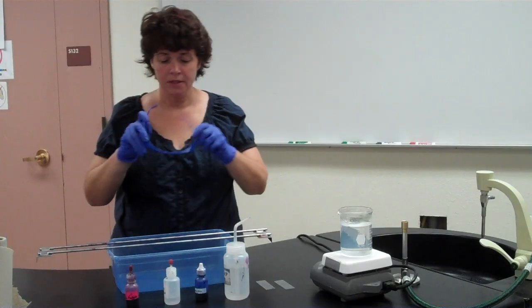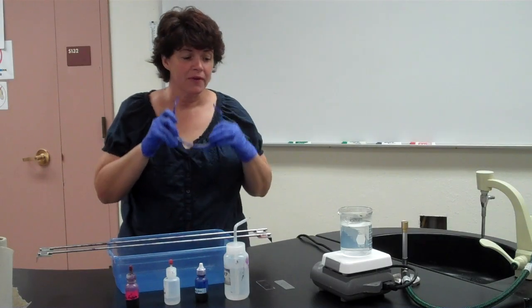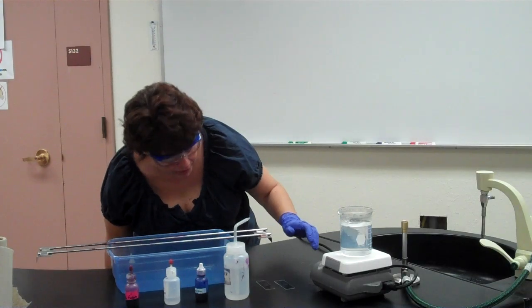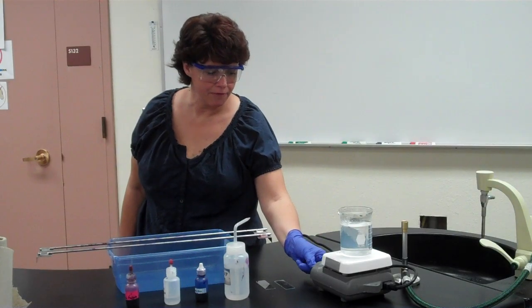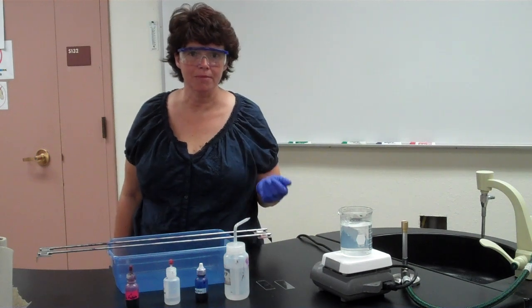So for this, one of the things you want to think about is I already have this on. It's been on for a while. We all know how long water takes to boil. So you don't want to wait till the last minute to start boiling your water. Okay, you want to have it boiling. Now, you don't actually see it boiling, but you can see steam is coming off of it. So we want it just enough. It doesn't have to be any kind of rapid boil. If you get it boiling too much, you want to turn it down. The idea is you just want steam coming off of it.